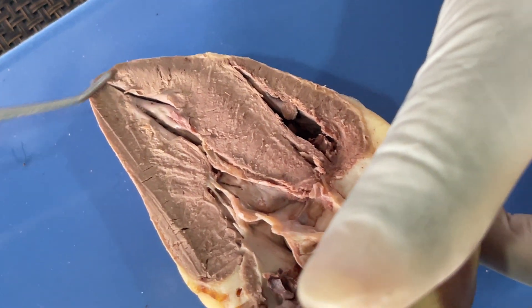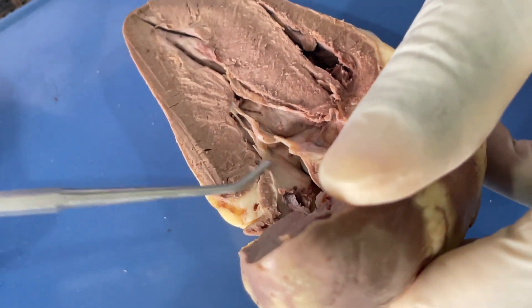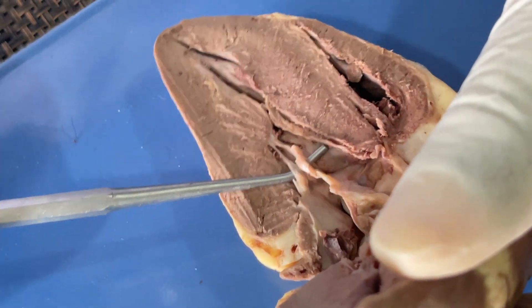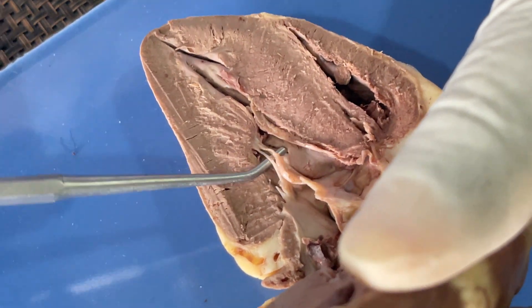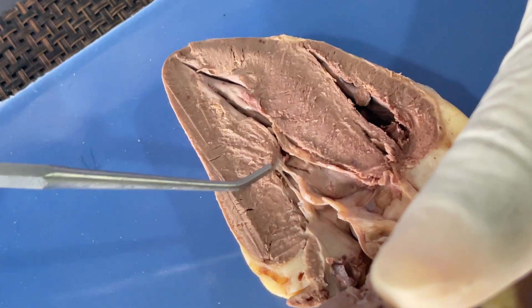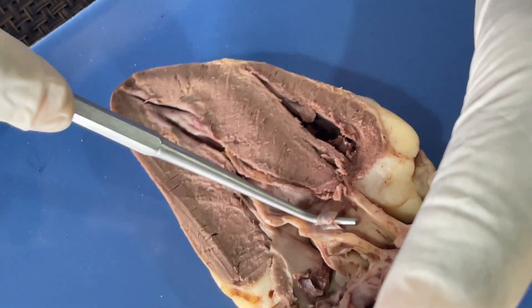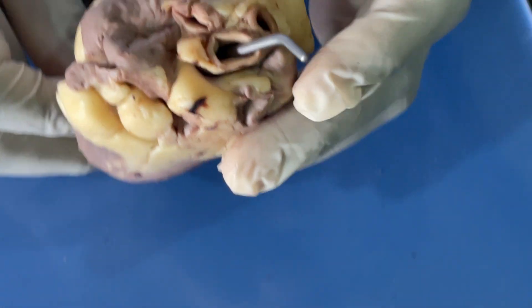When you come to the left side, we have this valve here — this is the left atrioventricular valve, also called the bicuspid valve or mitral valve. The bicuspid valve is also attached with strings, and the strings are the chordae tendineae, which are also attached to the muscles here. These are the papillary muscles. Going up to the aorta there is the aortic valve or semilunar valve, which leads into the aorta.